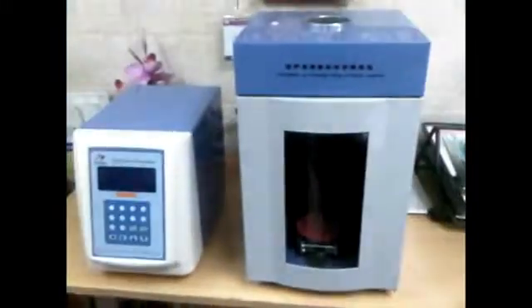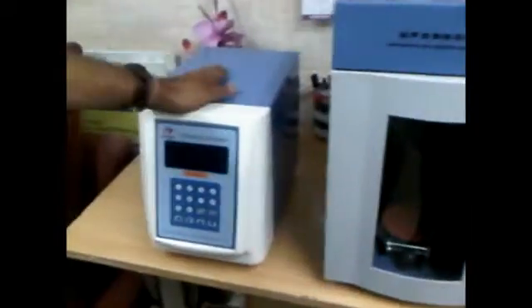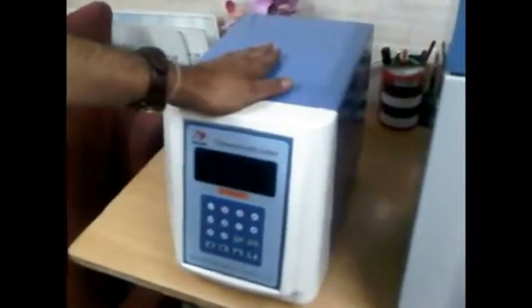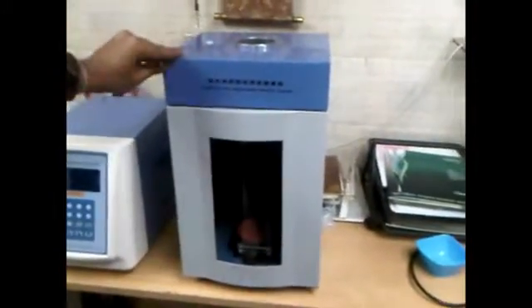Dear customer, we thank you for purchasing the Ningbo ultrasonic homogenizer. Your ultrasonic homogenizer consists of two parts: first is your ultrasonic controller and second is your ultrasonic probe.